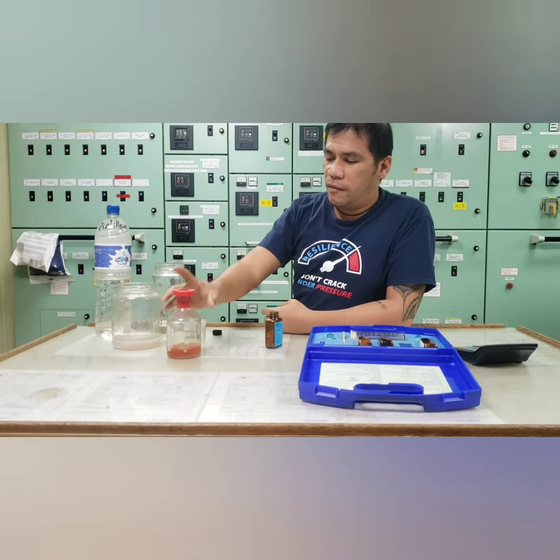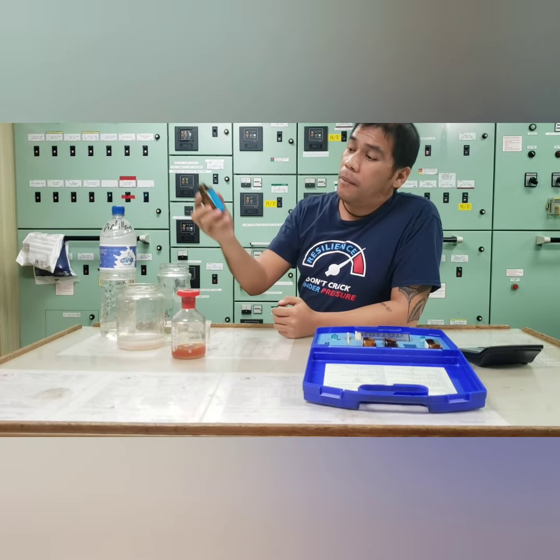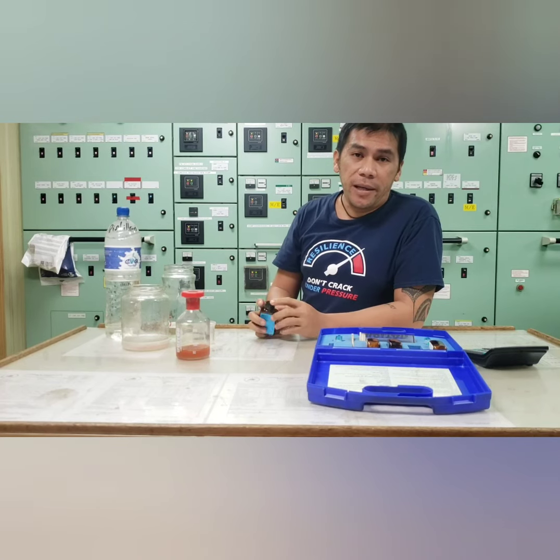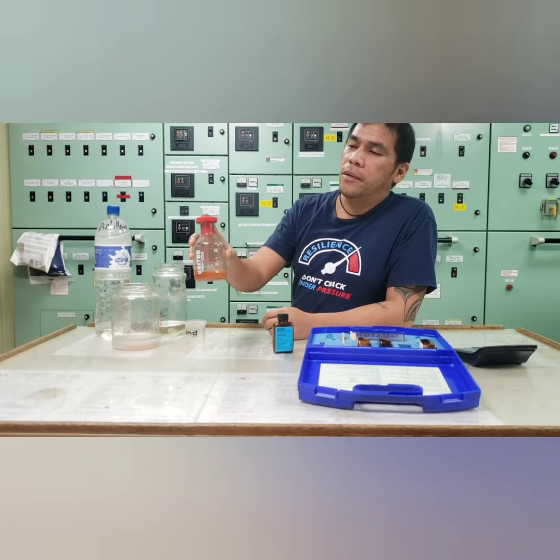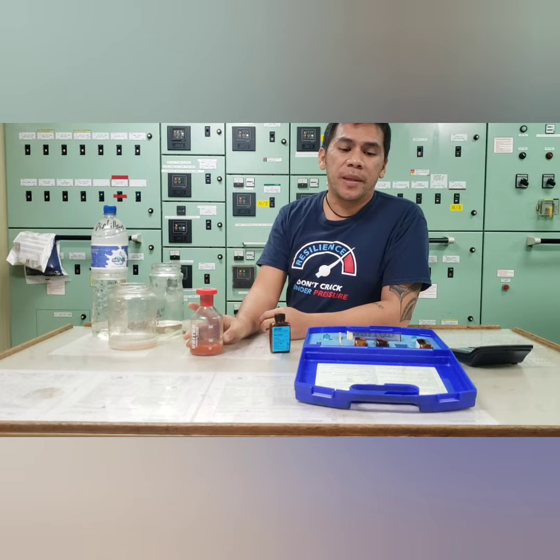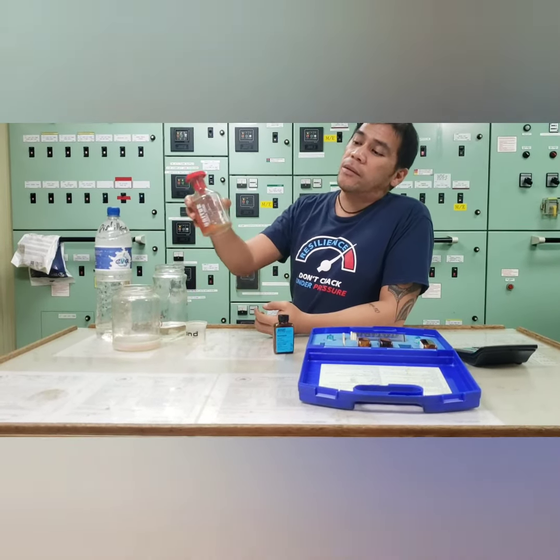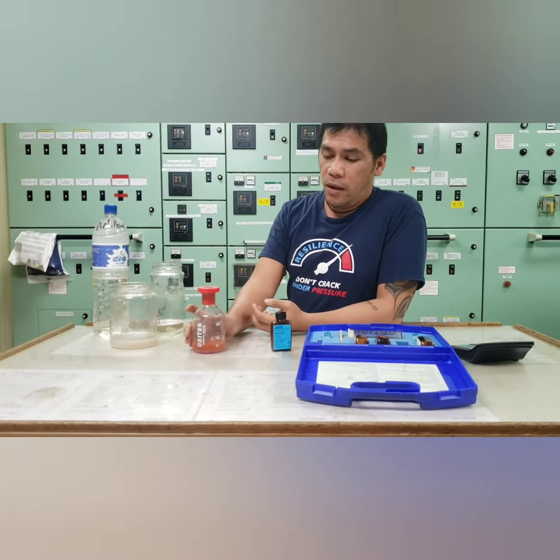The computation of this is number of chloride tablets times 20 minus 20, which will going to give you a value of 40 ppm. Now, so the normal value of our chloride content is only 50 ppm. Above 50 ppm, which it shows that there is a seawater contamination in our system.